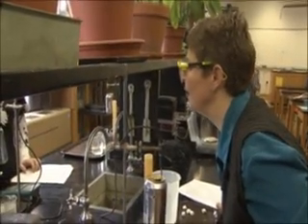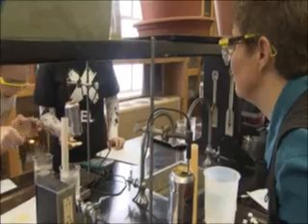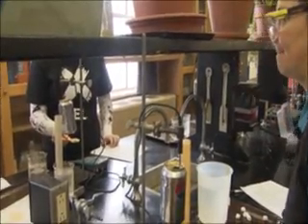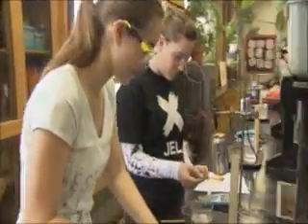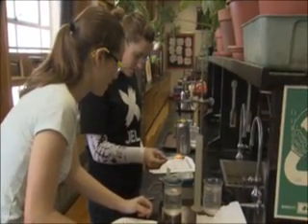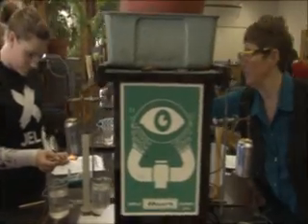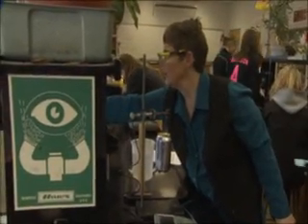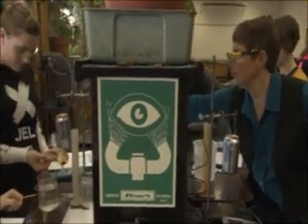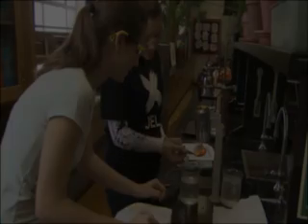Put the thing under. There you go — look into your food, because heat rises. Is that the baked one? Is this the first one you've done? You've got to watch it because it kind of gets — flip your chip this way, the other way, so it burns up. I can weigh it this way. I have control. Okay, let's do it.